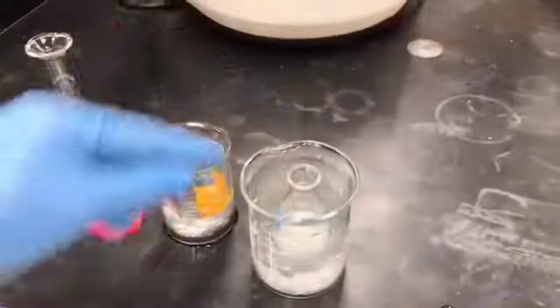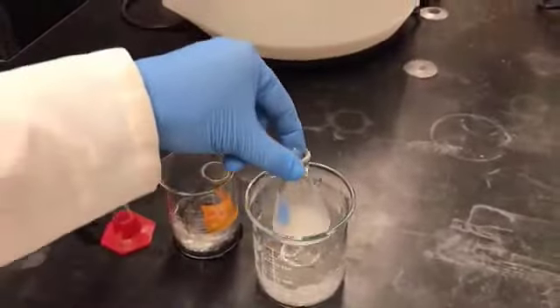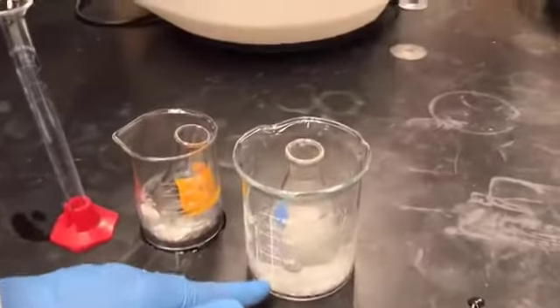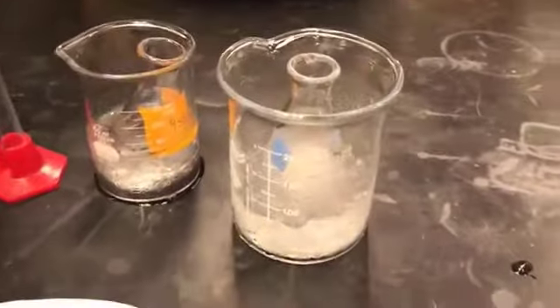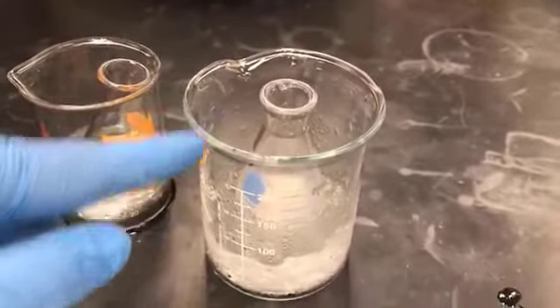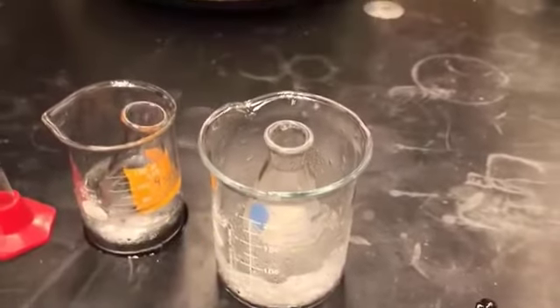So now crystallization is over. It's been 20 minutes. The flask is sitting in the ice bath. I just removed some water out of it because it was too watery, as the ice had melted. So now we are going to filter the crystals through vacuum filtration.